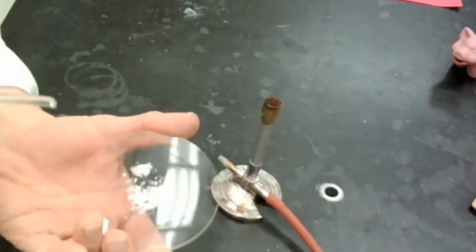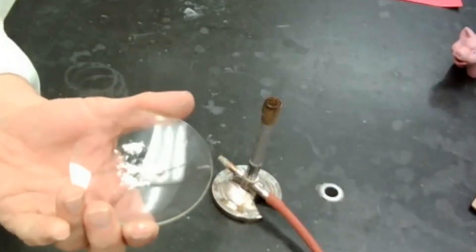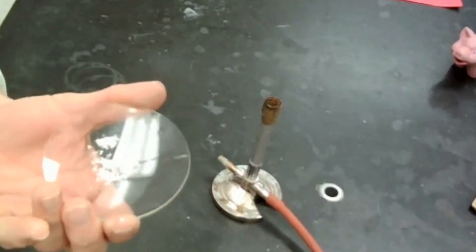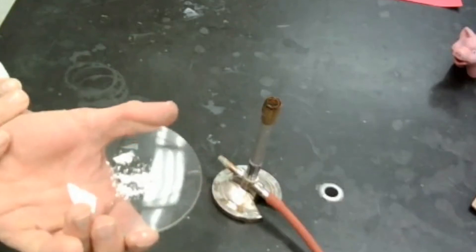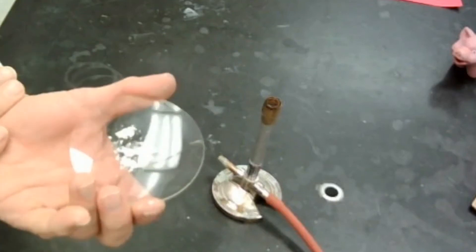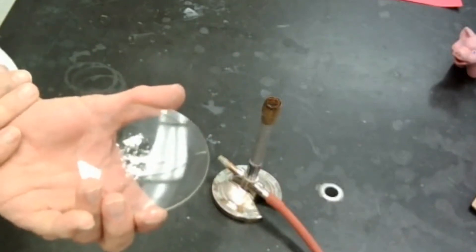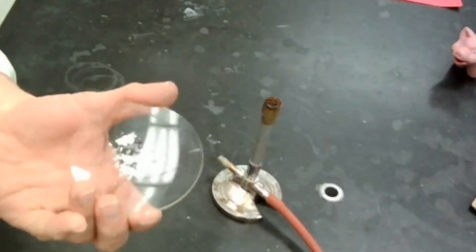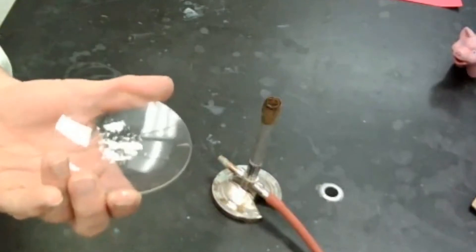Here's some leftover magnesium right there, a couple of little pieces here, but all of that. Now, one thing that you want to really make sure is that if we were to put this in water, it would be highly alkaline. So it'd be like pH maybe eight, nine, ten, something like that. Definitely could be dangerous if you got it in your mouth or something like that. So I'll be sure to wash my hands certainly before I eat lunch or anything like that.